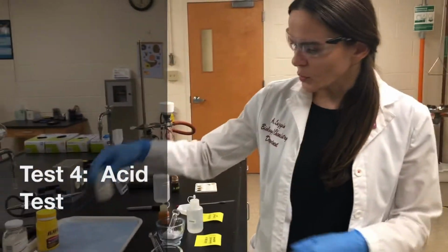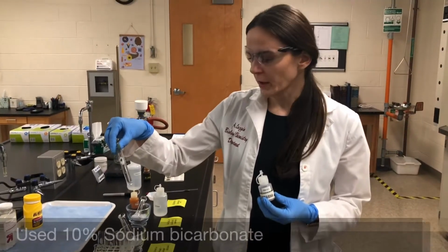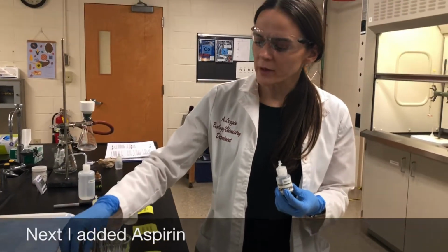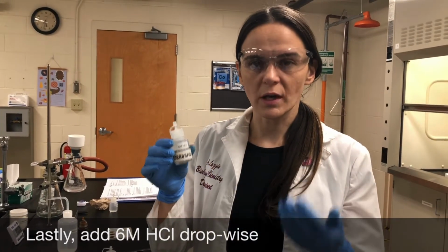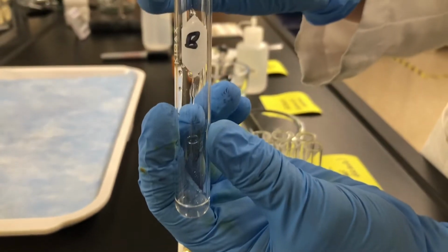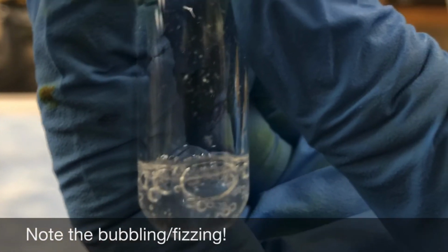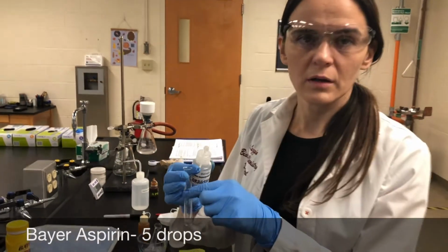Okay, and for the acid test, I have already added my 10 drops of the sodium bicarbonate, which is the base, and then I added the aspirin. So now I'm going to start adding drops of 6 molar HCl, which is hydrochloric acid, and we're going to note the bubbling. We're going to count the drops it takes for the bubbling to stop. So that was about 5 drops.